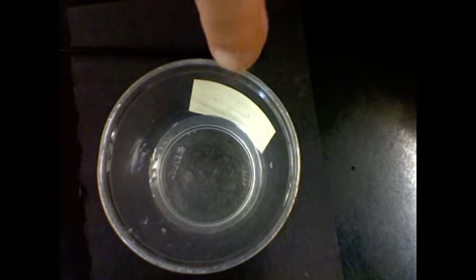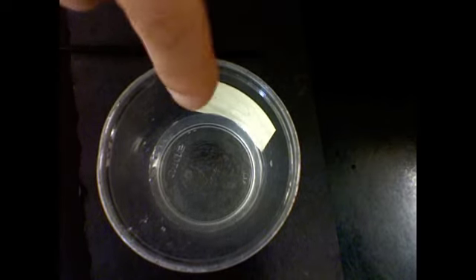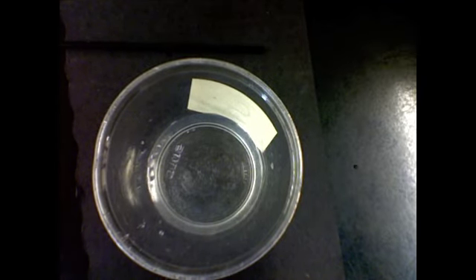And when we start talking about solutions, one of the ways to identify if something has become a solution is that it turns clear. You can see through it. It can be different colors, but it must be clear. See-through, yes. And when I compare the salt to the powder, they look very different.